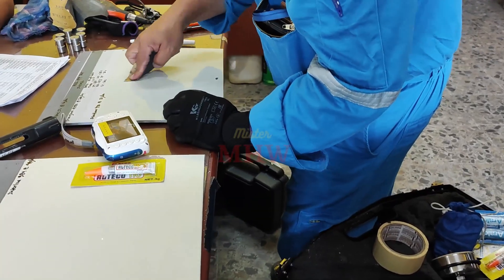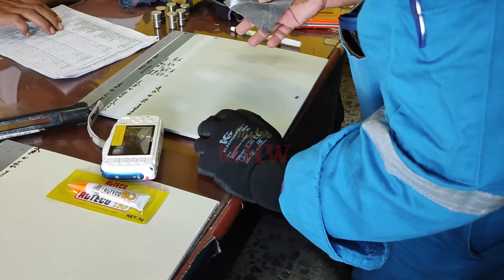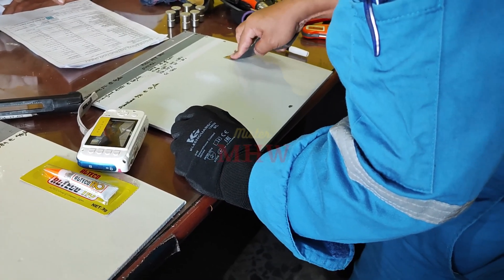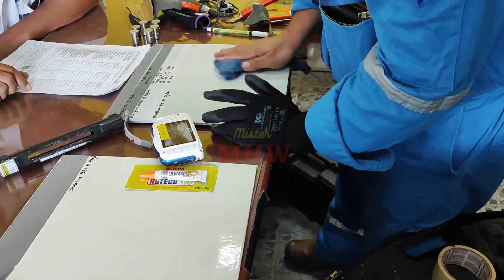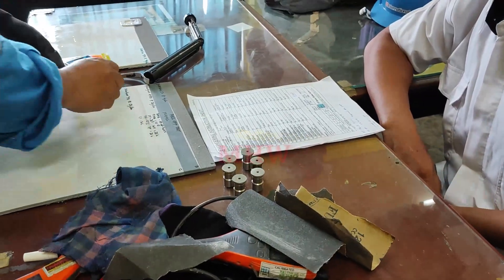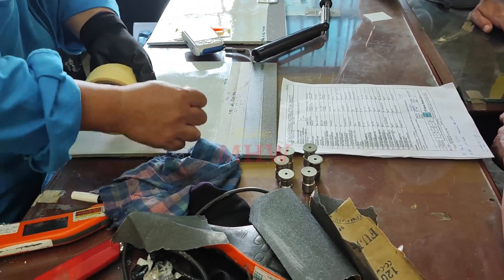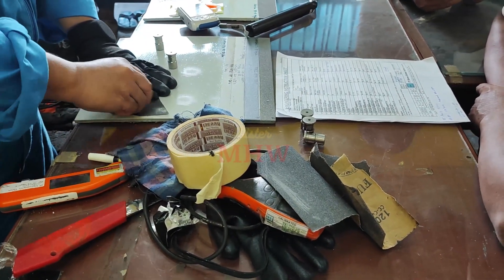The surface preparation of the workpiece uses fine sandpaper or other means of cleaning the coating that will not alter its integrity by chemical or solvent attack. If any light sanding is anticipated, choose only a very fine grade abrasive that will not introduce flaws or leave a residue. To reduce the risk of glue failures, the surface of the coating can be lightly abraded to promote adhesion of the adhesive to the surface. Care must be taken to prevent damage to the coating or significant loss of coating thickness.